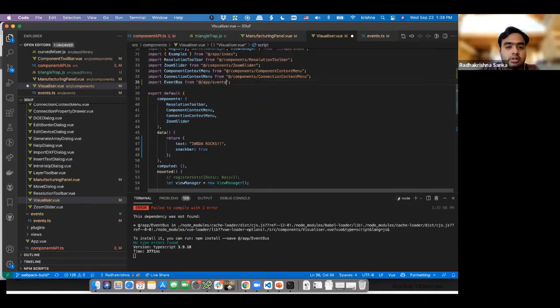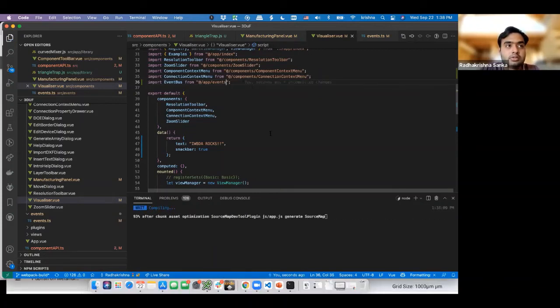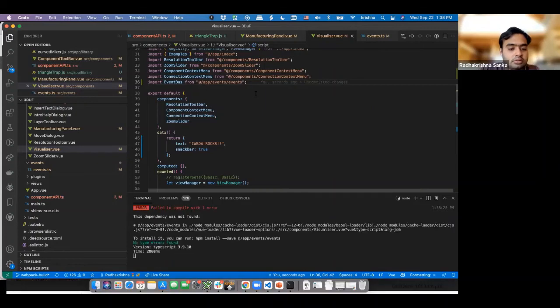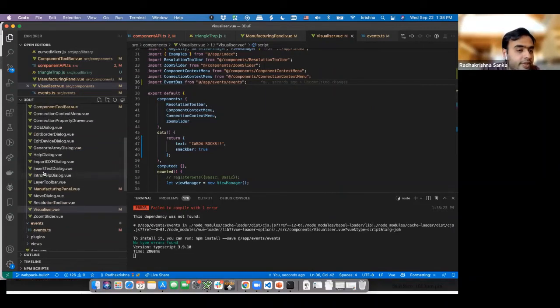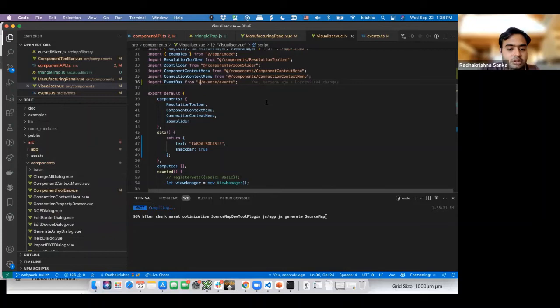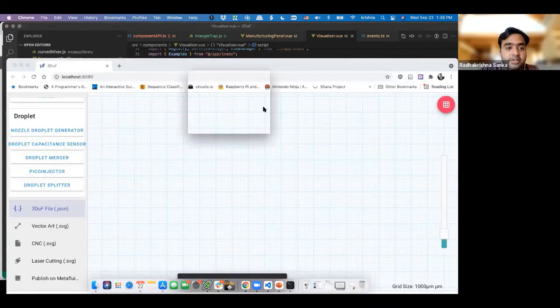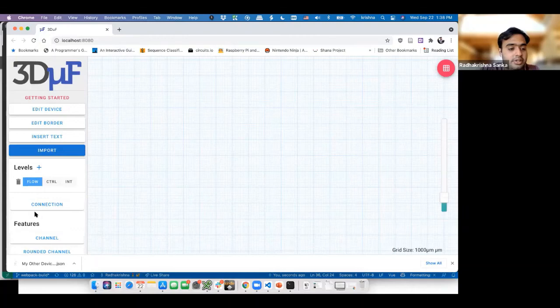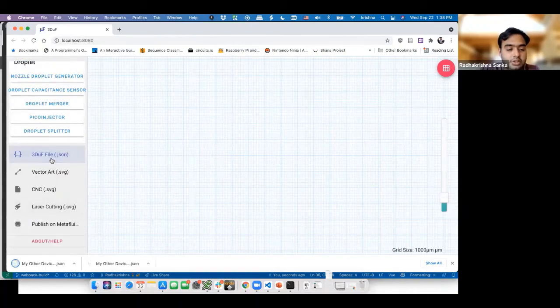events slash events. It's weird. There you go. So now that we have this, it starts off like this. But now when we click on this one, it should set it. Did not work. Why did it not work?